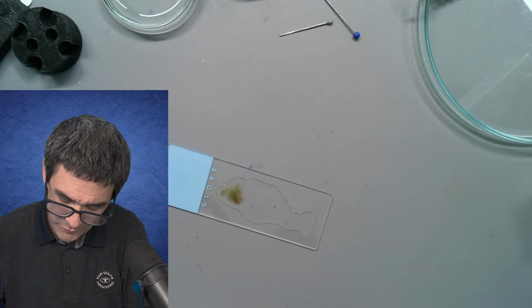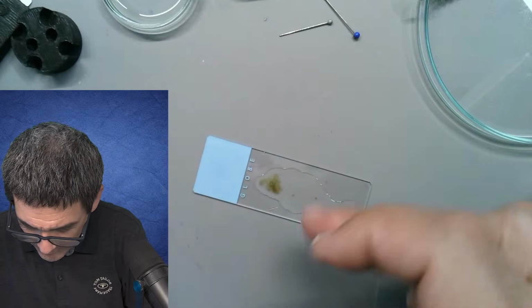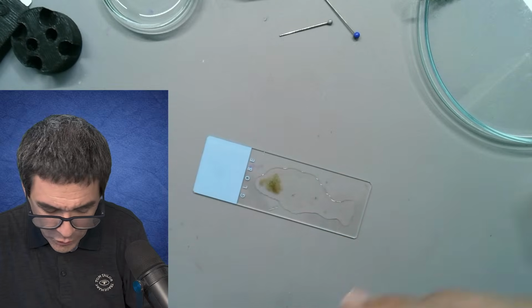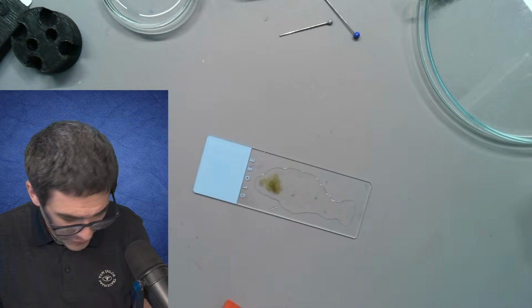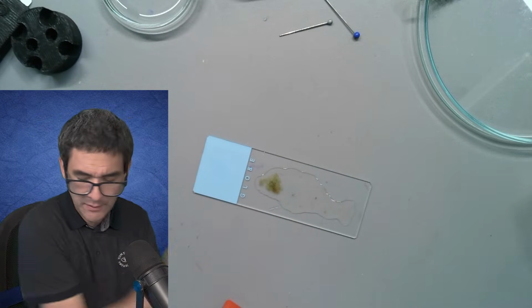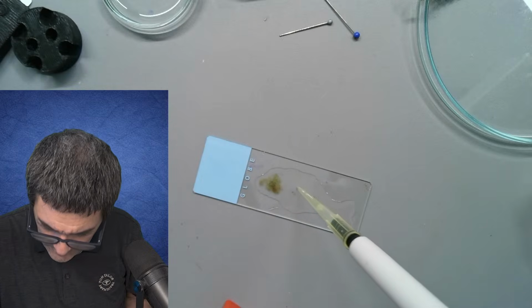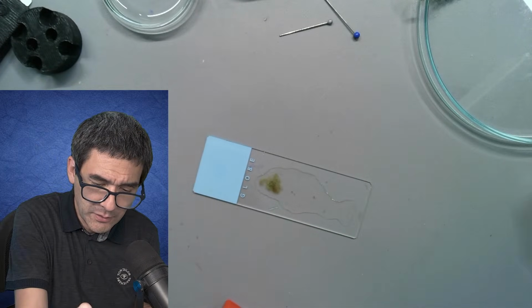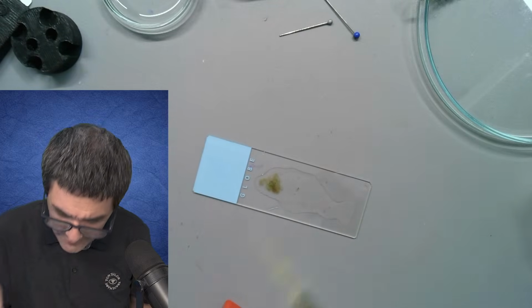And if you remember also when I started to make the sample, there was very little green stuff in there. So also the algae and whatever had not started to grow here. And I'm now going to remove quite a bit of this liquid again. I'm going to put it back into the jar because otherwise it's going to be way too flooded.